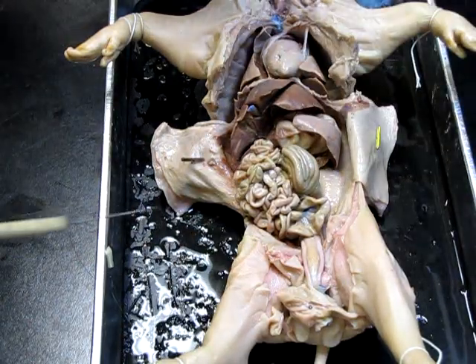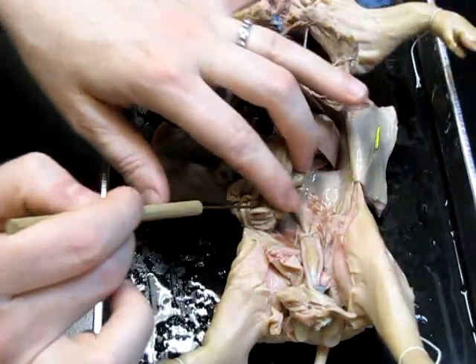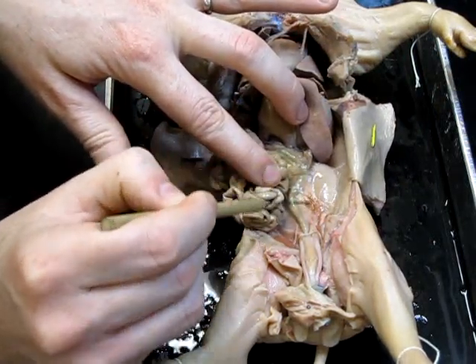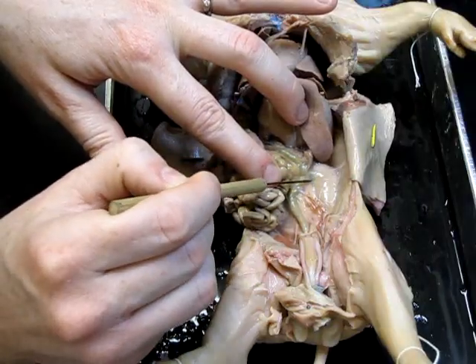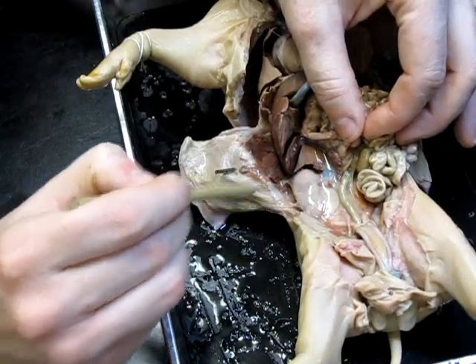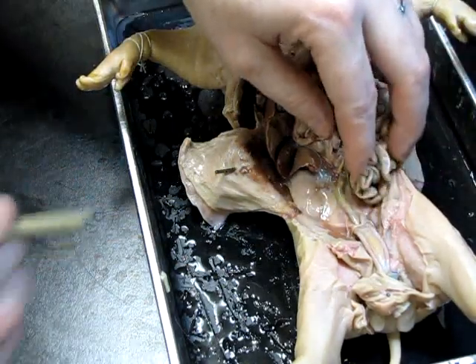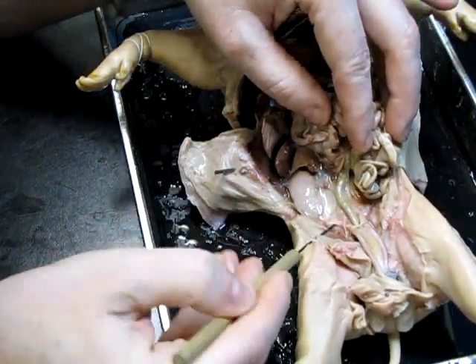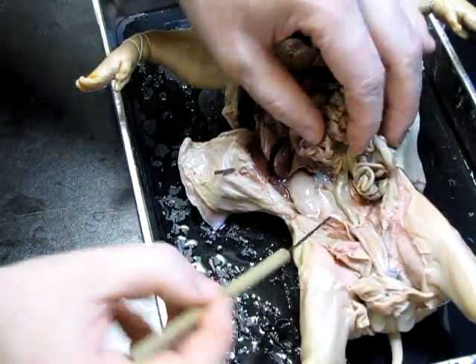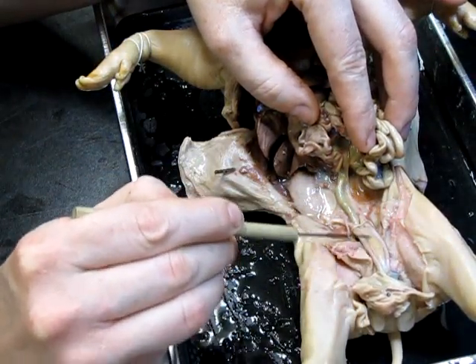Let's have a quick look at the urogenital anatomy of this animal. If I move the intestine aside, I can see this large bean-shaped lobe right here — that is one of the kidneys. Moving over again, I can see the other kidney right here. So two kidneys, one on either side, always lying on the dorsal body wall of the animal. You can see this little tube attached from the kidney down to this structure right here, which is the bladder.